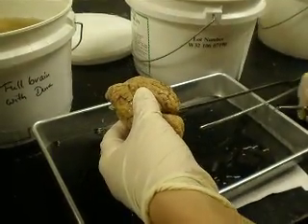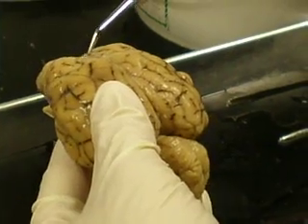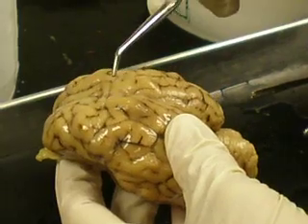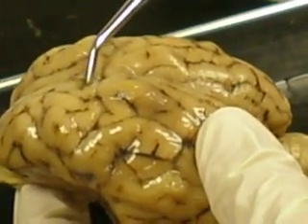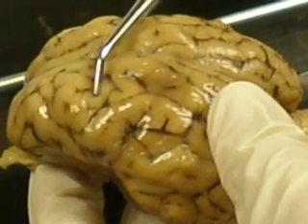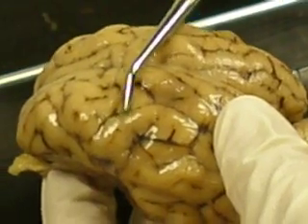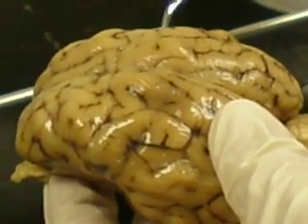This is the longitudinal fissure. This is the central sulcus right here. In front of the central sulcus you have the pre-central gyrus, which is where the primary motor area is. Behind the central sulcus you have the post-central gyrus. That's where the primary somatosensory area is.